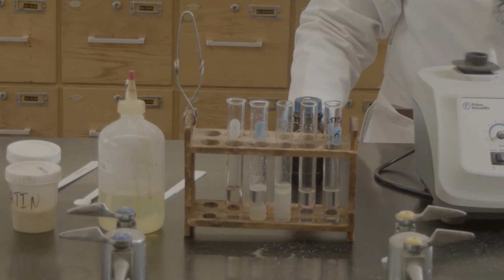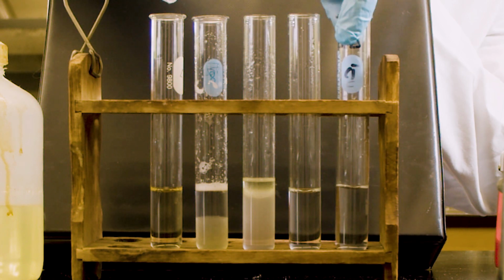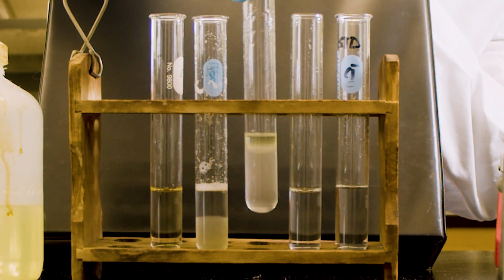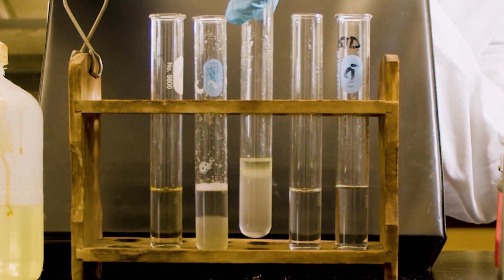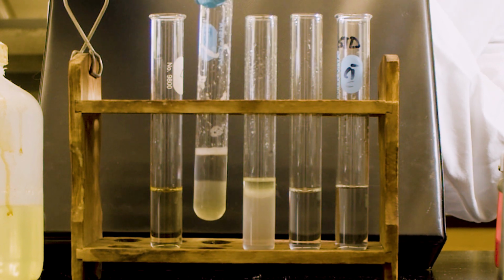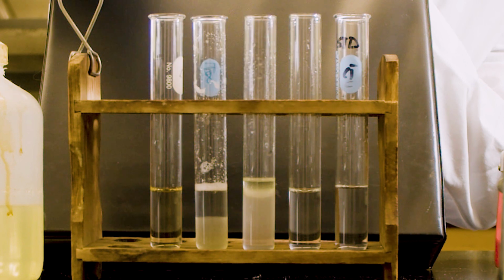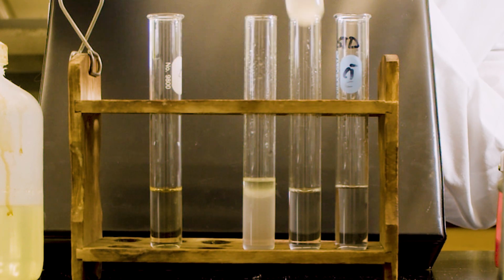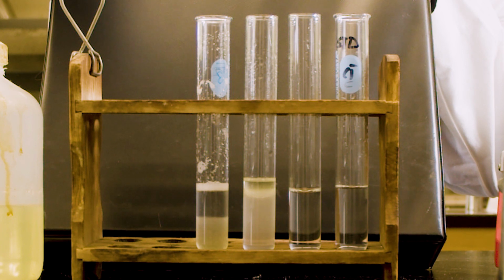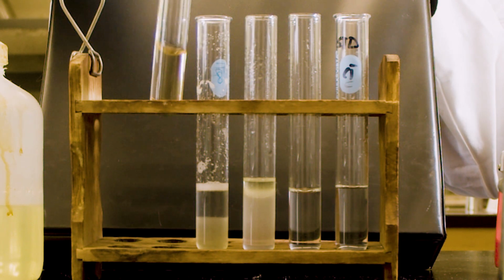The next part we will do for hot water. This is sodium chloride with the water, no layer. This is sucrose, still doesn't have any layer. You can see a beautiful layer with oil and water. It doesn't dissolve. This is gelatin. Gelatin with the water, and you can see there is some chunk of gelatin at the bottom. And crystal clear, you can see the iodine. It doesn't dissolve. You can see the chunk of the iodine.